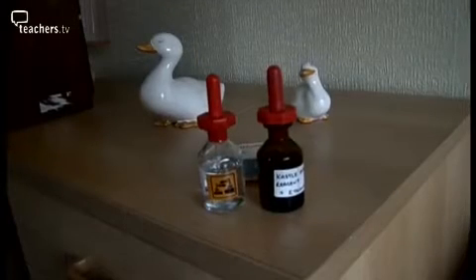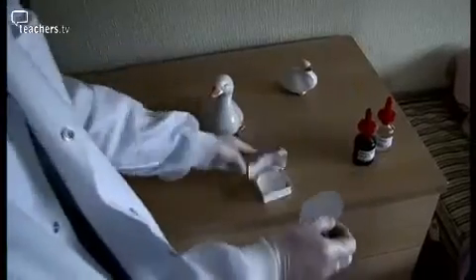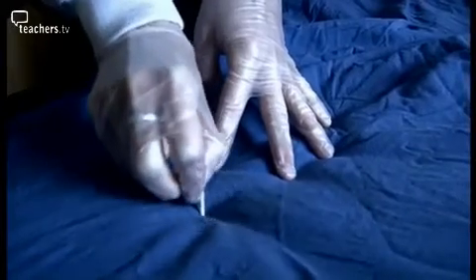There's Kastle-Meyer itself, which is actually something called phenolphthalein, and another chemical is hydrogen peroxide. And hydrogen peroxide is the same stuff you use to bleach your hair. We take a small piece of filter paper and take a very small sample of a blood stain that we can see, or an area that we want to test, maybe where we can't see any blood but there may be some there. To demonstrate Kastle-Meyer, we placed a trace amount of blood on a bedsheet. What we then do is apply 2 chemicals to the filter paper where we've sampled an area.